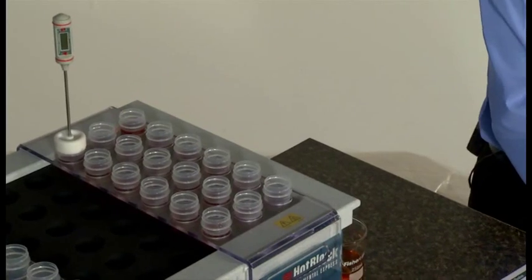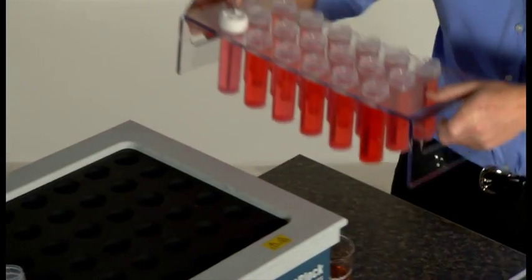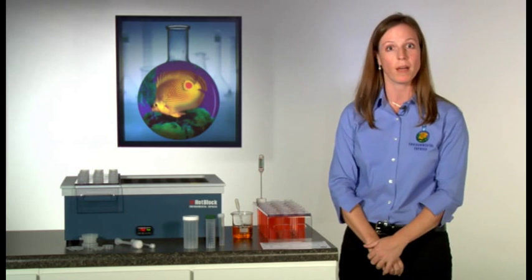Samples are then allowed to digest for the amount of time called for in your method. Now the samples are removed from the block, allowed to cool, and brought back up to volume.